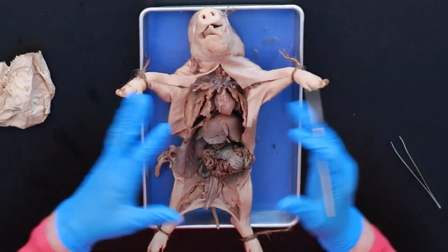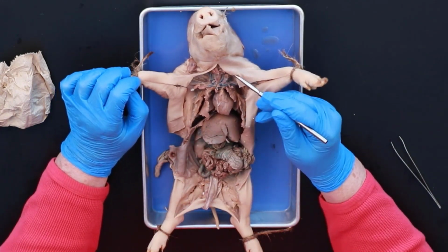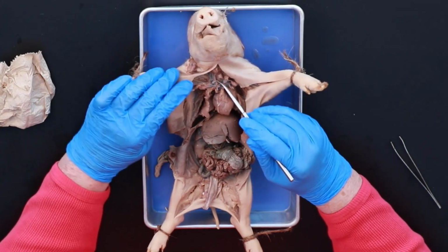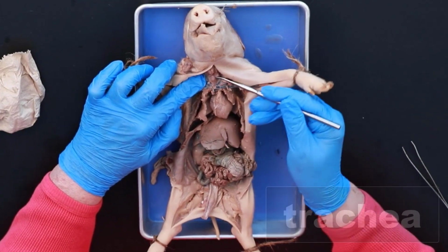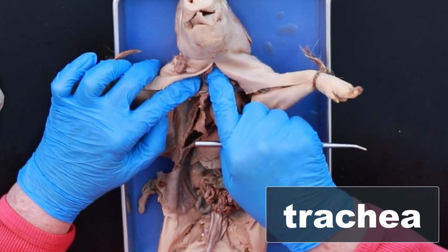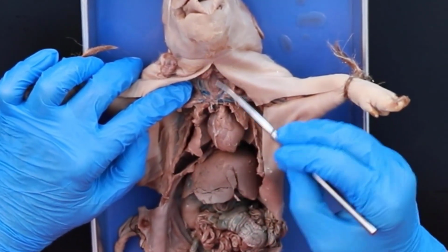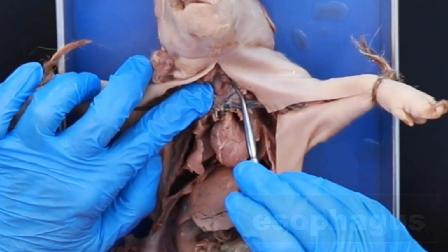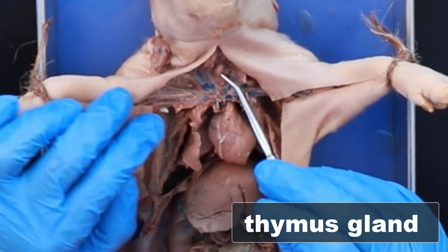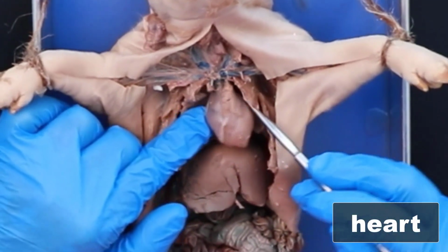All right, so let's start with the general organs. We're going to start at the top up here, and if you could run your finger up here, you would be able to see that that is the trachea. I can feel the little cartilaginous rings. Behind that I've got the esophagus, which I'll show you a little bit later. This is what's left of the thymus gland. But as we come down, here's obviously your heart.